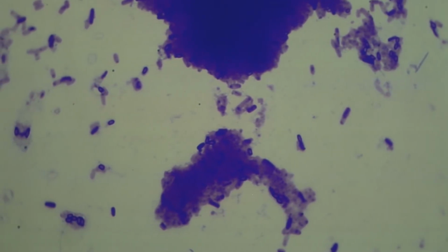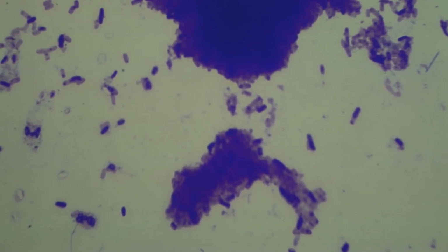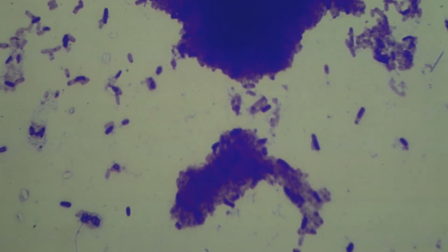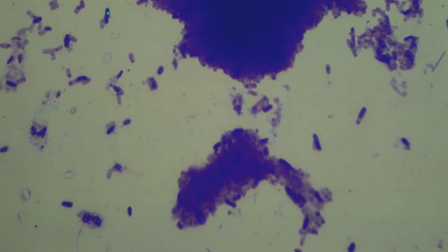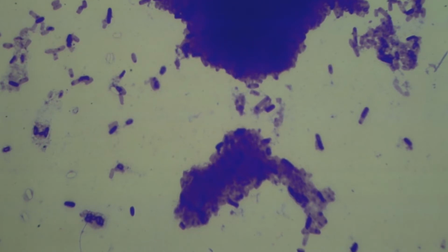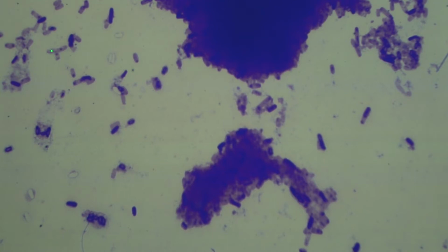called crystal violet. Now, on this slide here, I have Bacillus subtilis. And I want you to see these dark purple, long, thick rods that look like sausages. That is what we call a vegetative cell of Bacillus subtilis. In addition, if we look around, we start to see some egg-shaped structures. And at times, we see that some of these long rods did not take up the crystal violet as well. That is because these are starting to die.